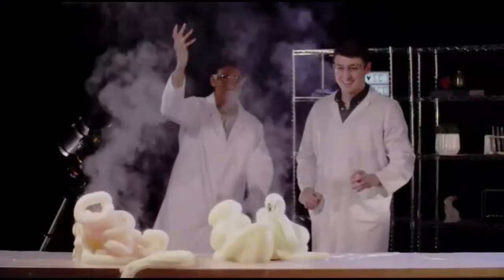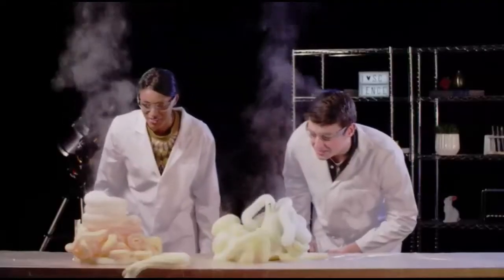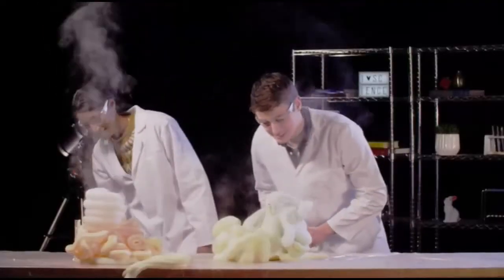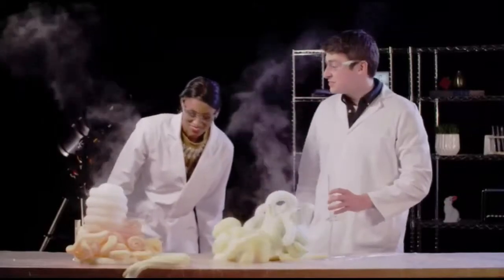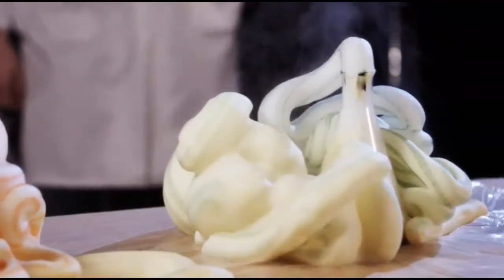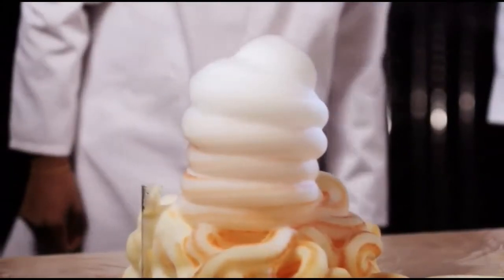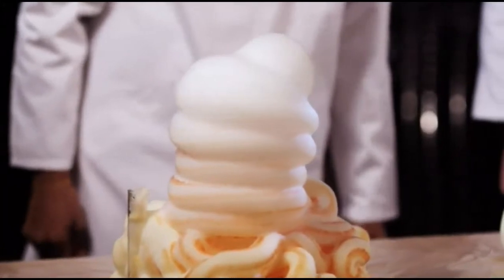That's all steam, isn't it? Still going. That food colouring is really making it look like toothpaste. Well, now you know why it's called the elephant's toothpaste reaction. Exactly. So the oxygen gas that's being produced by the reaction is being captured in bubble form by the washing up liquid that we put in. So you can see with your own eyes just how much oxygen is being produced.